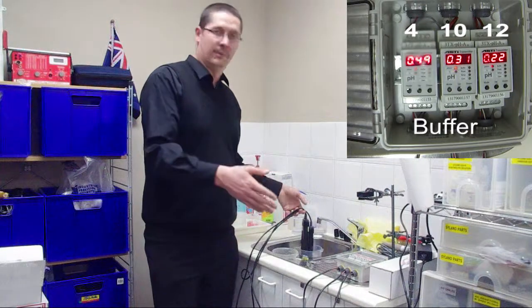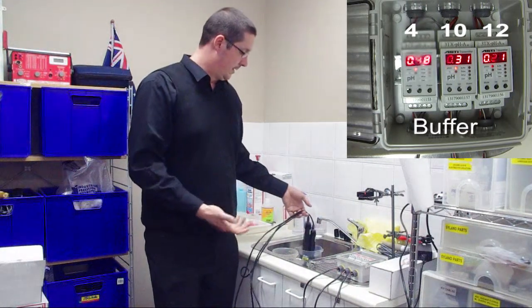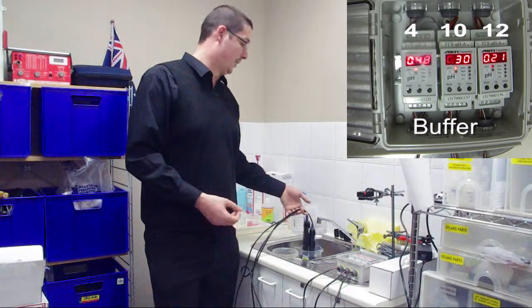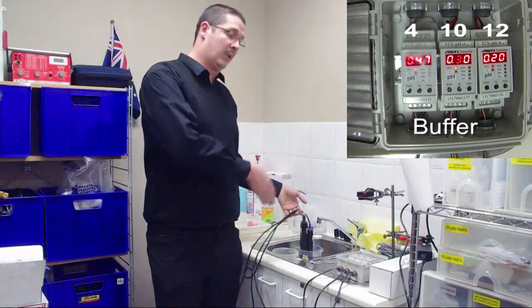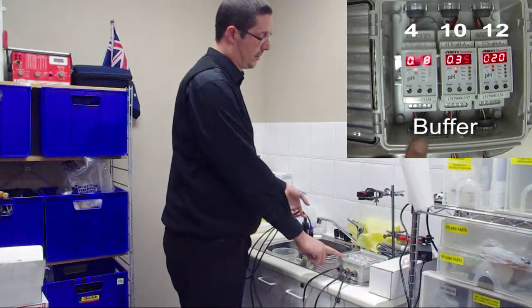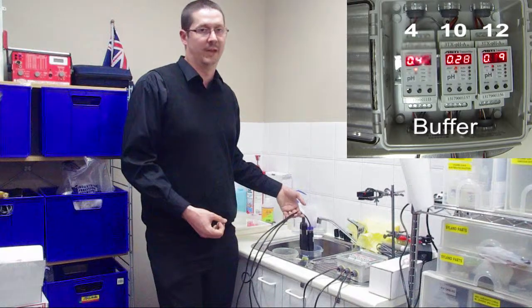So as you can see, we have a different pH measurement across these sensors depending on what we've calibrated to. Now the next question is, which one would you trust? Well, for this one here, given that we've got an acidic solution, it's a lot lower than our target pH, but I would be most happy with the sensor on the left. I would be most happy with this transmitter calibrated to pH 4 rather than calibrated to a basic solution such as pH 10 or 12.